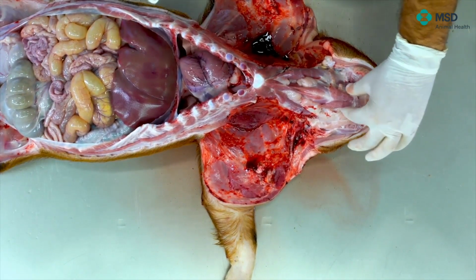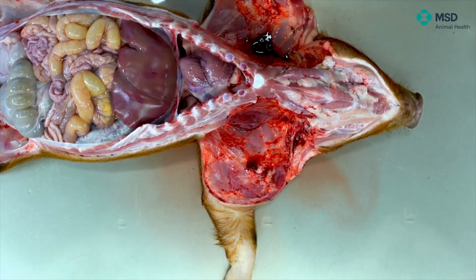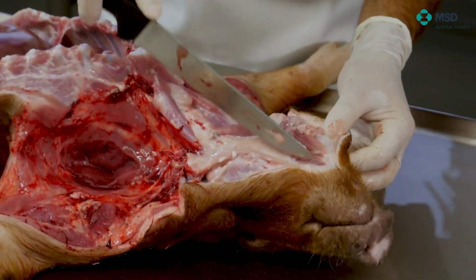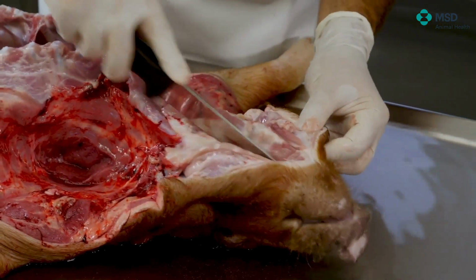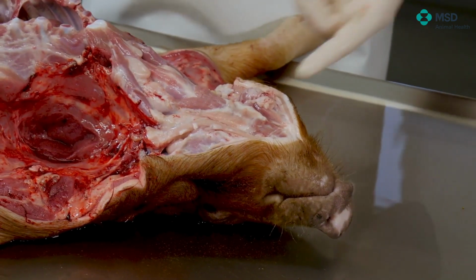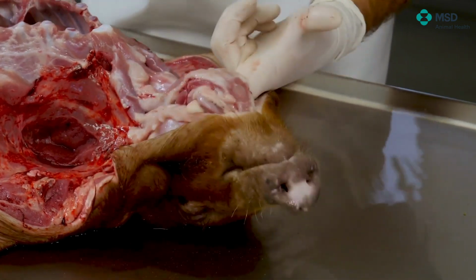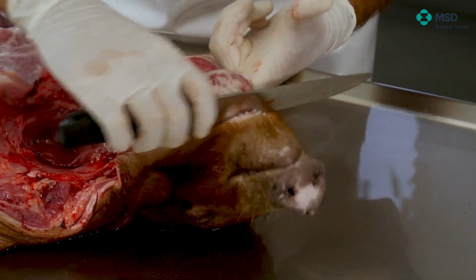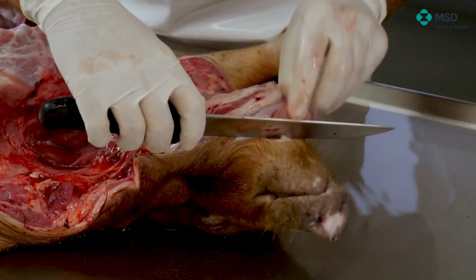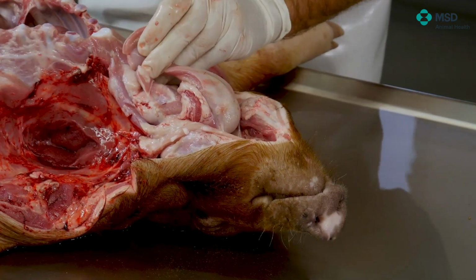So first of all, what we do is just to cut the muscles around the tongue. So we are just doing this kind of separation, and the most complicated area is to separate in the Mentonian area. And in the Mentonian area, for example, we can use my own finger, make some pressure, and then try to cut the tongue. So that way, I'm separating the tongue, and I'm reaching one area which is very important in pigs, which is the oropharyngeal ring.